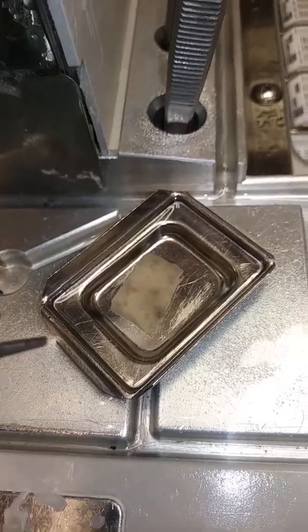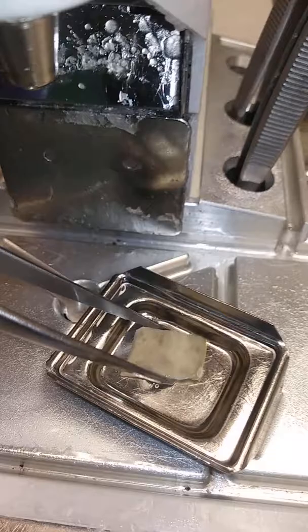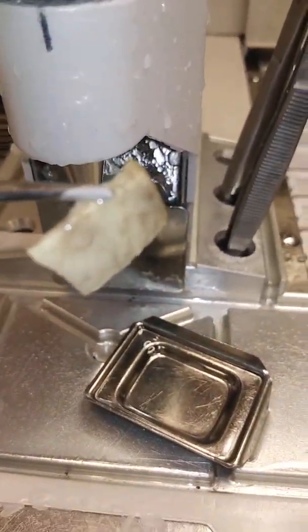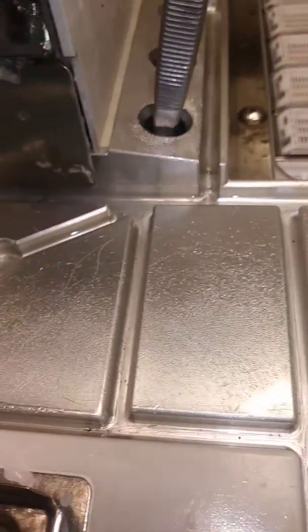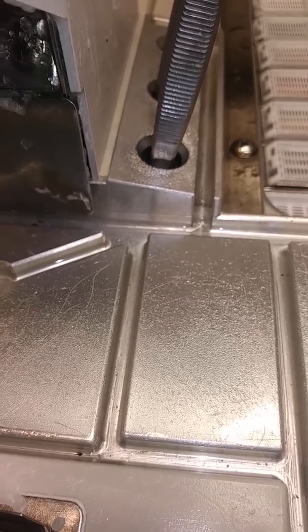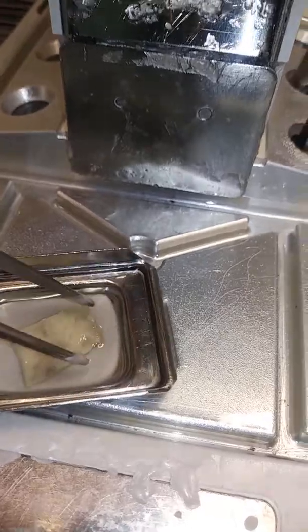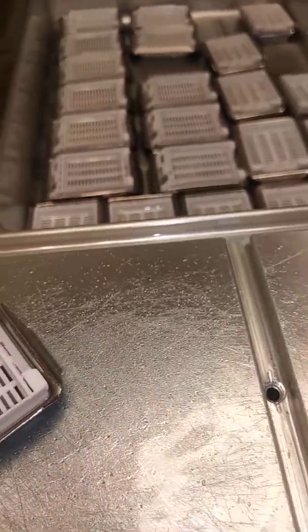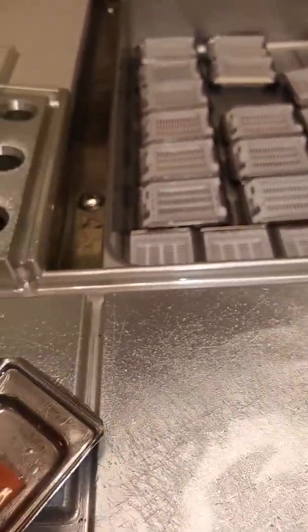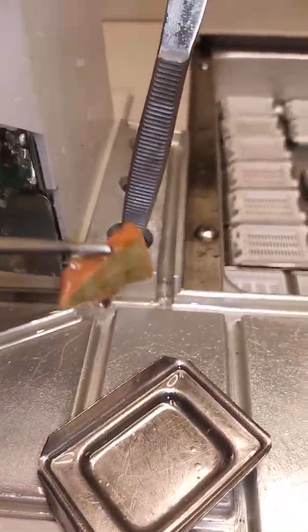This is another piece — there's a uterus here — and you move it to the cold area. And again we have a beautiful piece of liver. Let's see how it looks — it's a beautiful piece of liver.